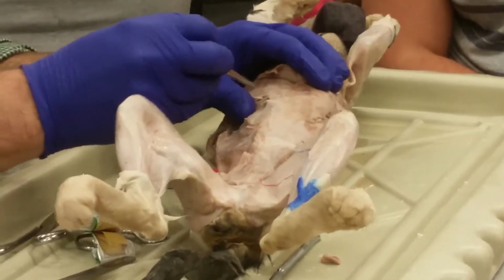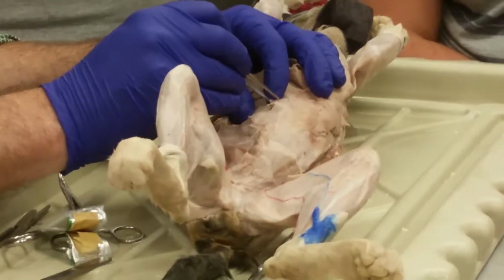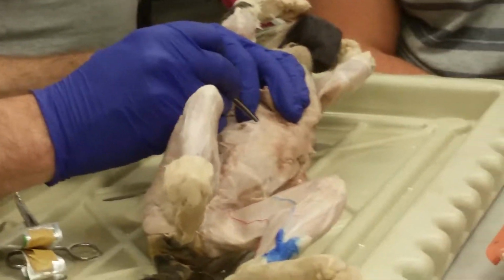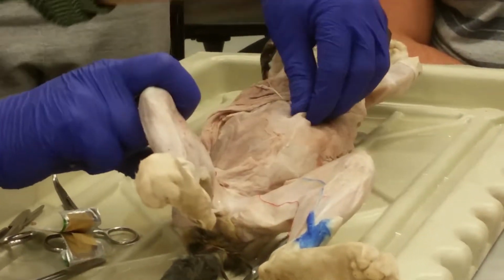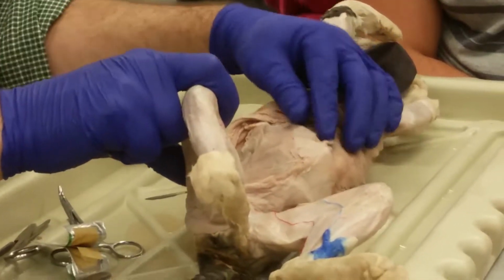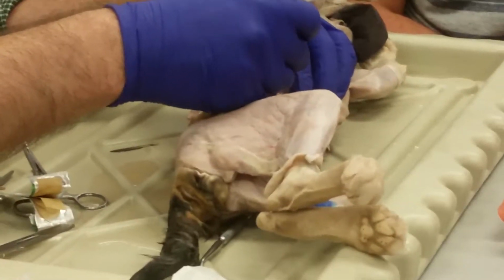Alright, yeah. So now it looks like the fibers are going this way, but these are just strands of the aponeurosis, right? Those little feathery looking things. The fibers are actually going this way on this muscle. Okay? And then underneath it is the transverse abdominis still. I know that's a little hard to see.